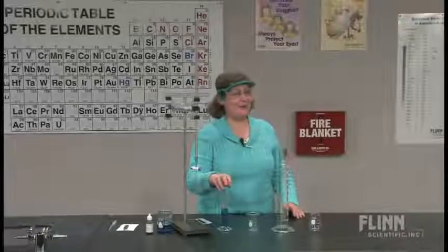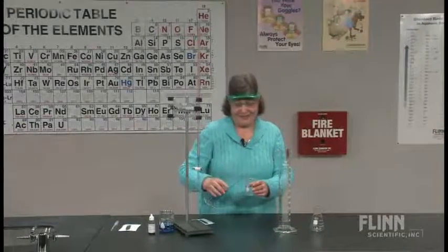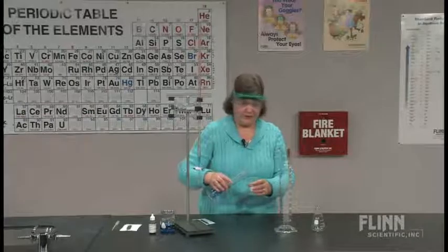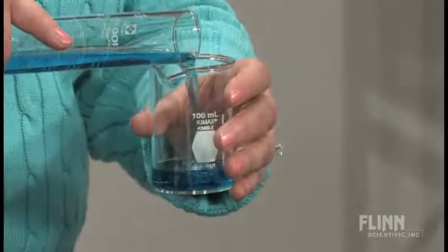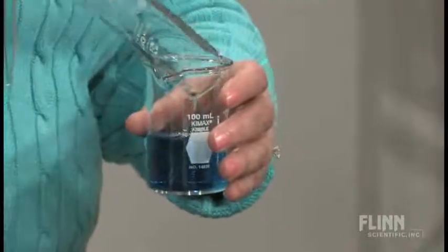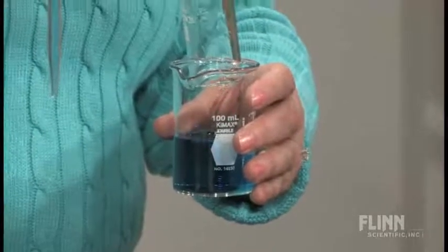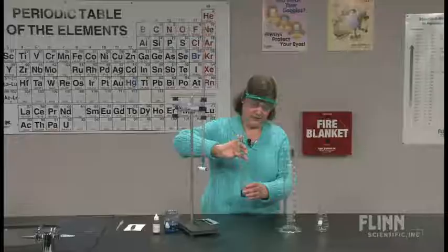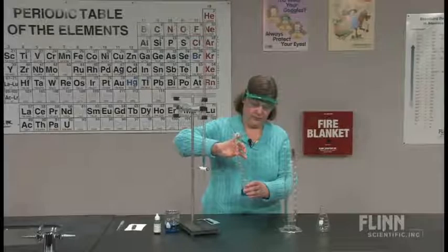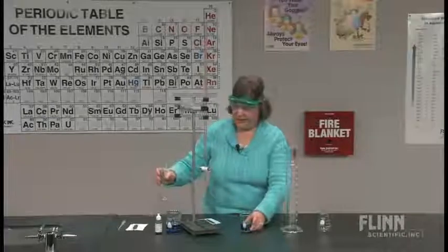So I'm going to take from the graduated cylinder, and I'm going to pour into the beaker. And now it is important to have good technique not to spill any. So having said that, I'm going to spill it. But let's try not to. And I want to try to obviously get as much out of that as I can, so I'm going to get those last couple of drops out of there. Again, because the point is I want to read the volume and I want to compare what the volume measurements are. So I think I got the last little bit out of there.